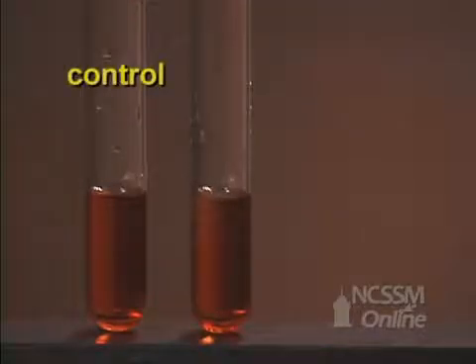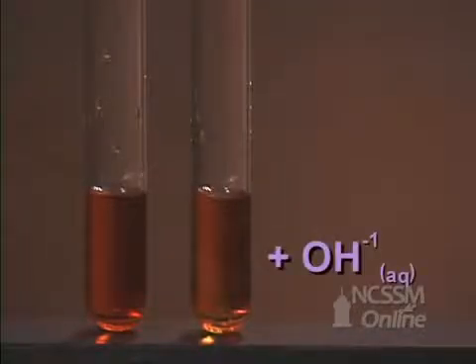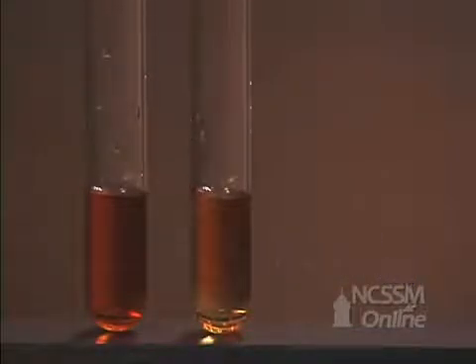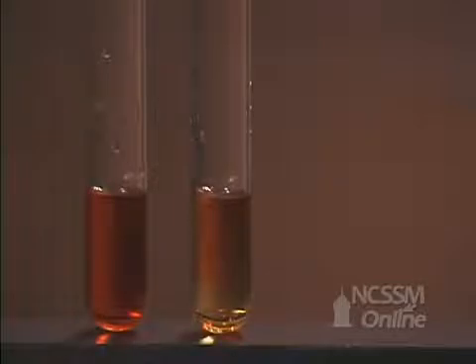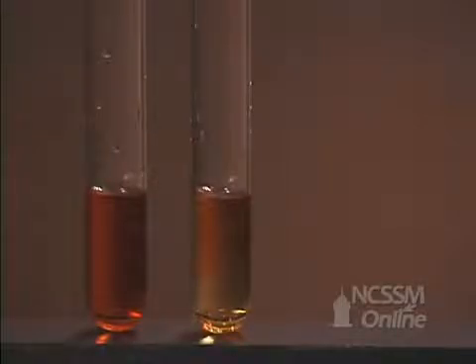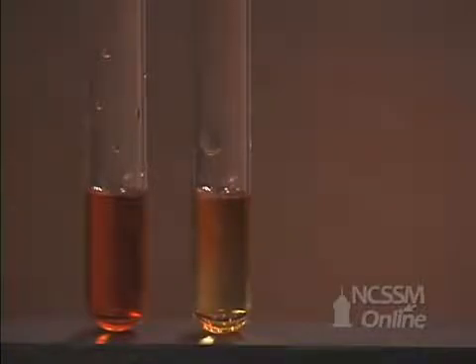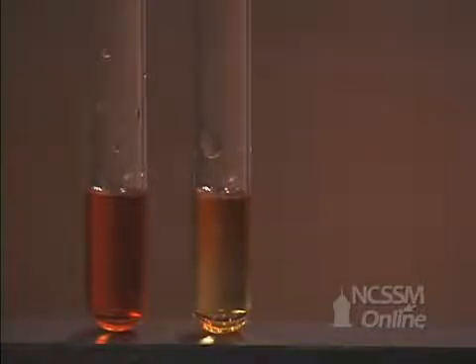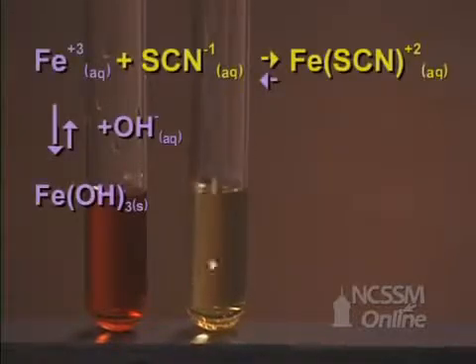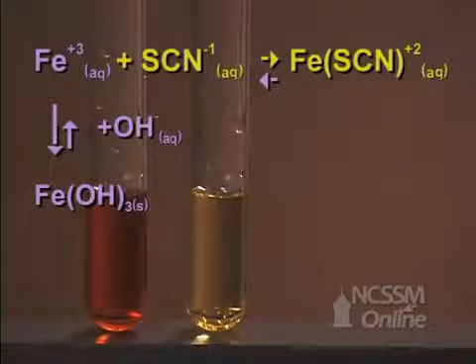We will now add some 0.1 molar sodium hydroxide solution. We notice that the red color decreases significantly, indicating that the reaction equilibrium has shifted in the reverse direction. The hydroxide ion precipitates the iron ion, effectively removing it from the solution. The equilibrium shifts in the reverse direction to try and increase the concentration of the iron.